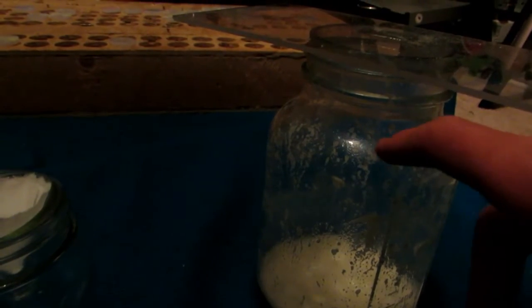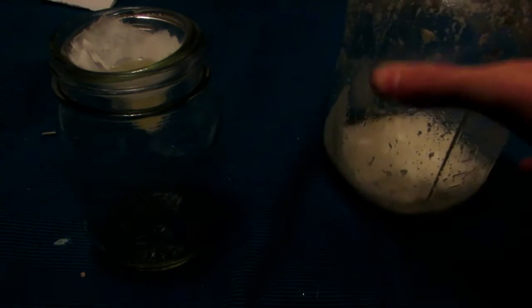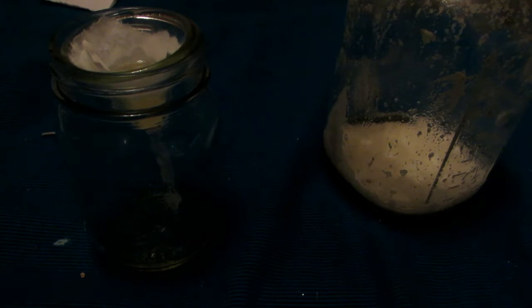Here I have a separate smaller canning jar, a glass funnel, and a piece of coffee filter to catch any impurities. You can see that the bubbling made it quite a fair ways up the container, so you do want to be cautious of having it spill over. The worst that's going to happen if it spills is hydrochloric acid bubbles overflowing the sides, but it'll also mess with your yield. We can now go ahead and slowly start to filter this mixture.